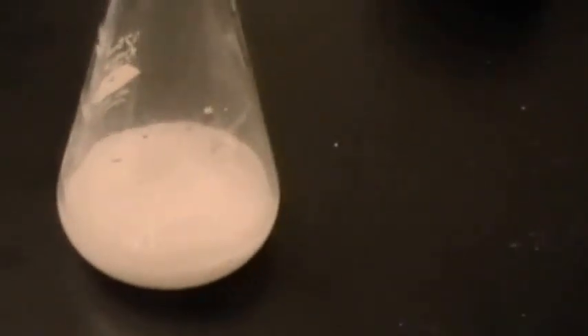I'm too busy recording. Look at all that CO₂ loss!